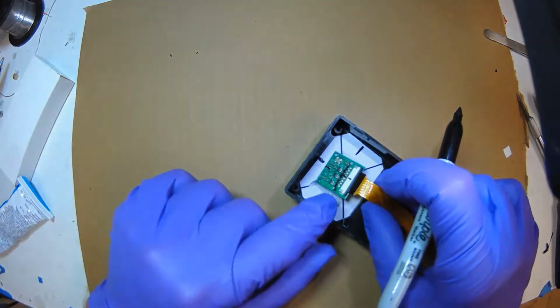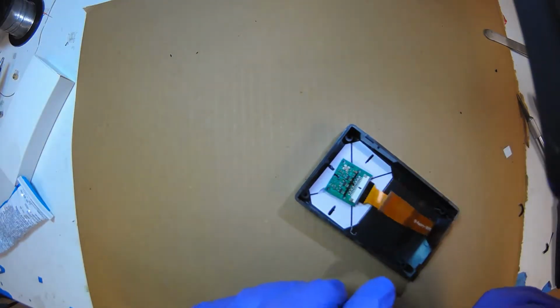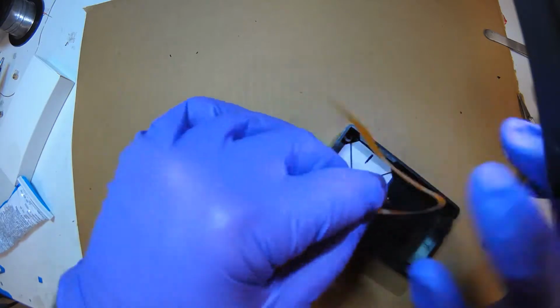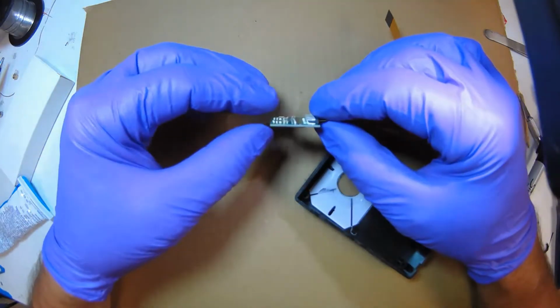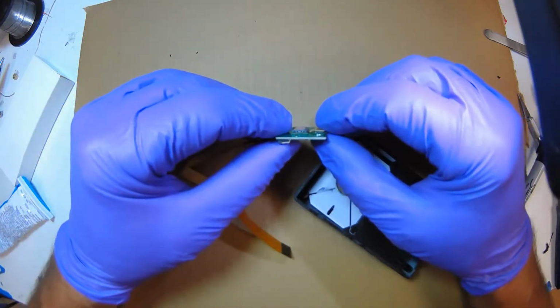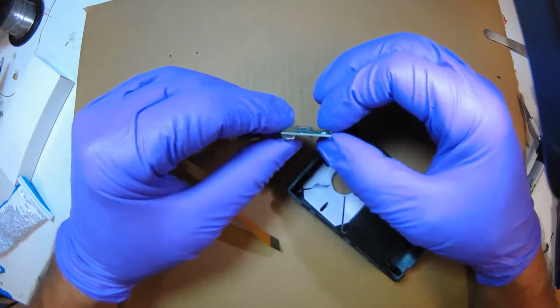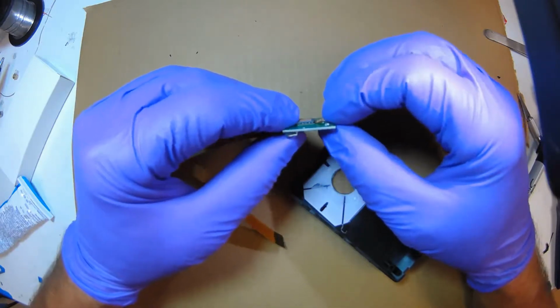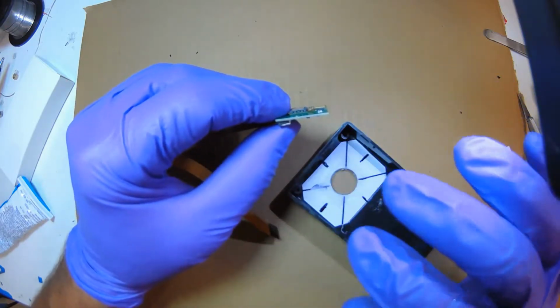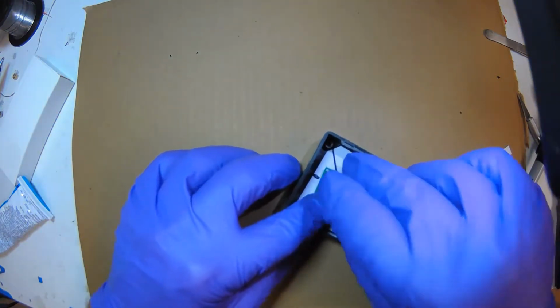So now I can place this on the glass. And you want to make sure the glass, let's look at it on a side profile. The highest thing here is luckily the glass and the connector are about the same height. So you should have 2 points that you can put against the glass. Okay, so basically this is going to lay here.